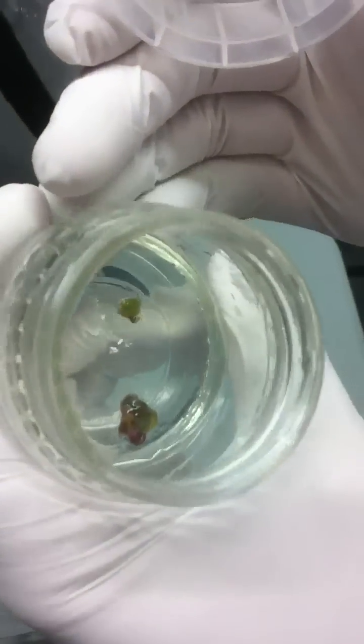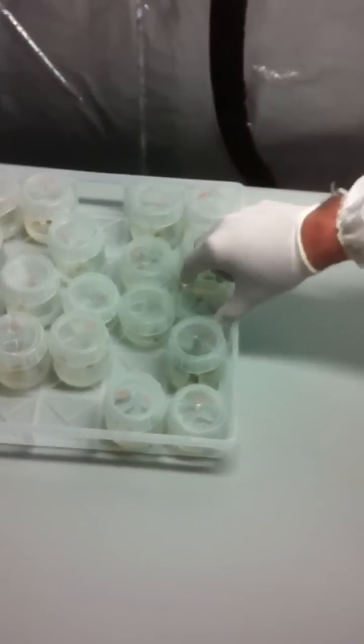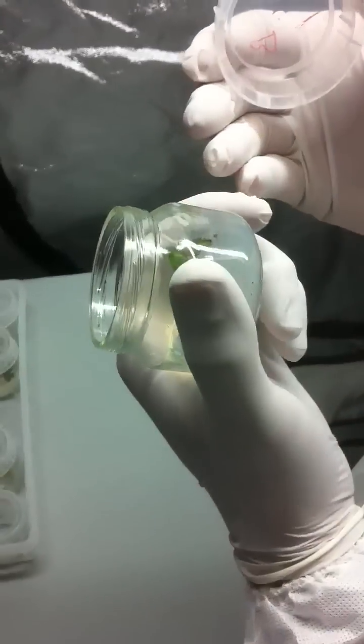Doesn't look like anything really happened. So are those just little chunks you cut off, basically, then? Mm-hmm. Stuck them in there. Trying to be clean. These didn't really take.